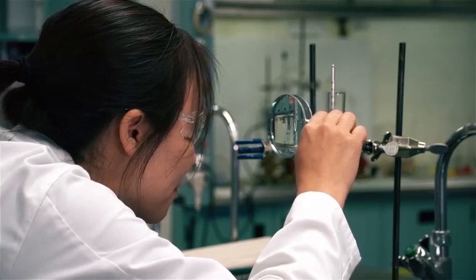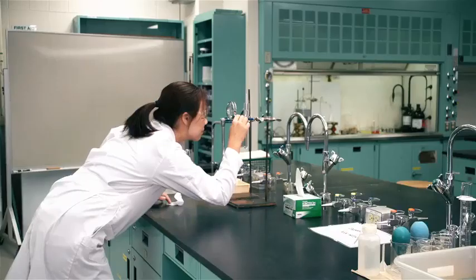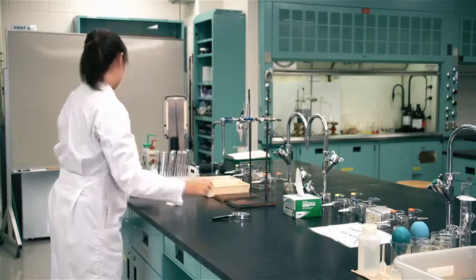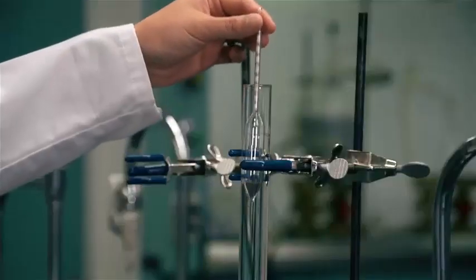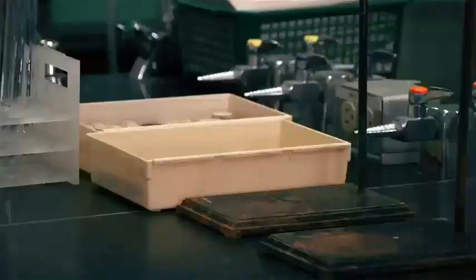The correct hydrometer reading is that point on the hydrometer scale at which the main surface of the liquid crosses the scale. Determine this point by placing your eye level with the surface of the liquid. Read the scale where the surface of the liquid becomes a straight line crossing the hydrometer scale. Do not read the scale where the meniscus touches the hydrometer. Clean all hydrometers with deionized water, wipe dry, and place in the box.